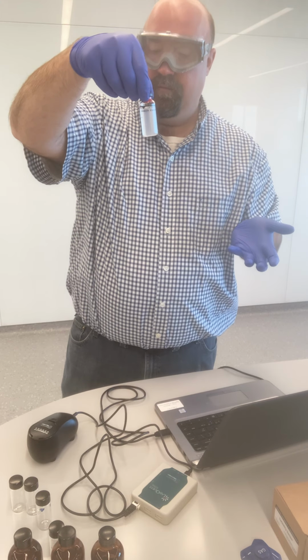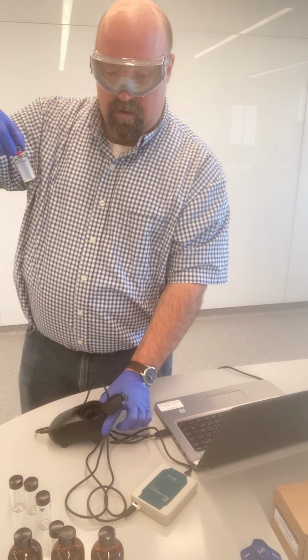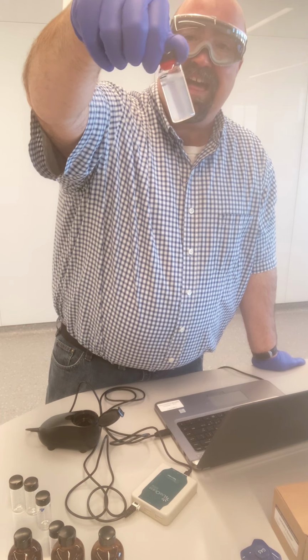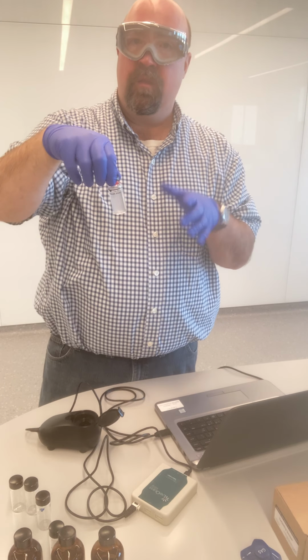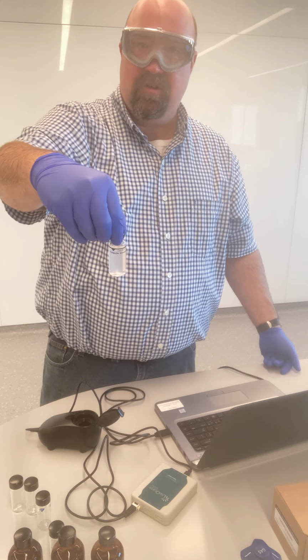on that glassware. The other thing I need to keep in mind when I'm inserting these cuvettes into the meter is I always want to make sure that the orientation is going in the same way each time. Imperfections in the glass could lead to different light intensities passing through. So the way that we correct for that is just to simply make sure that we're always putting this in there the same exact way each time.